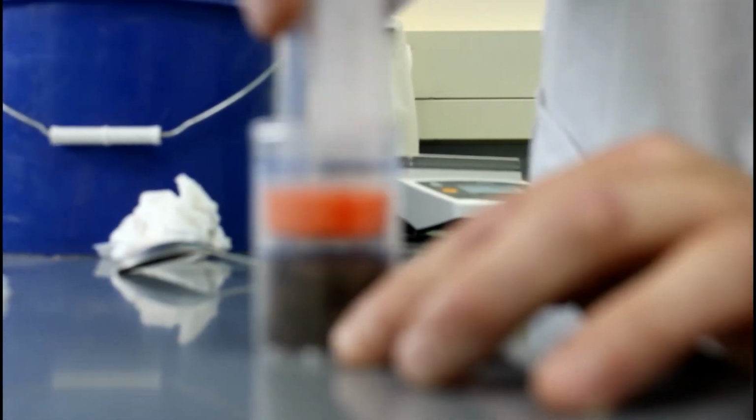To ensure the bulk density is homogeneous in the microcosms, the repacking is made in 2 steps. One repacking at 2.5 centimeters and the second repacking at the line of 5 centimeters.